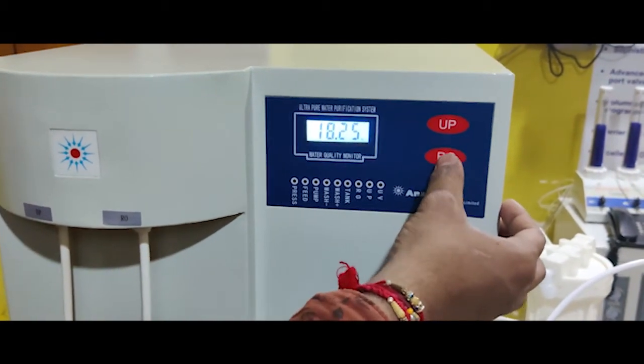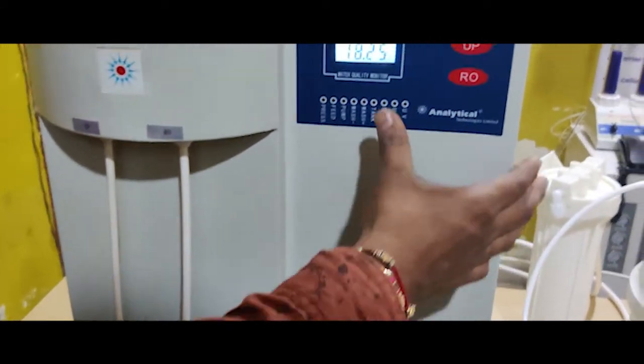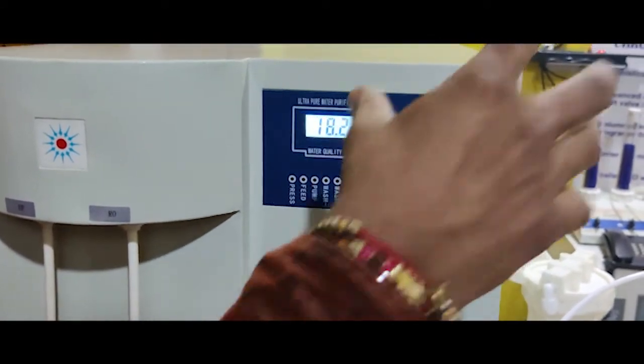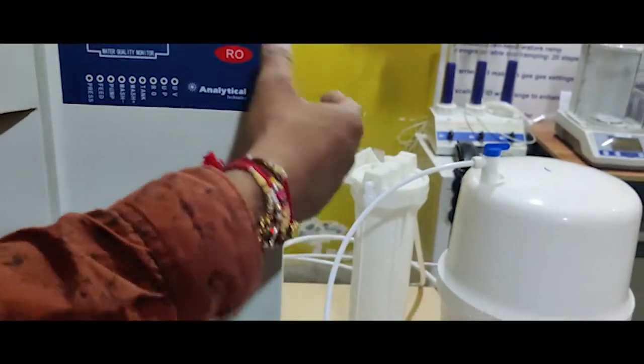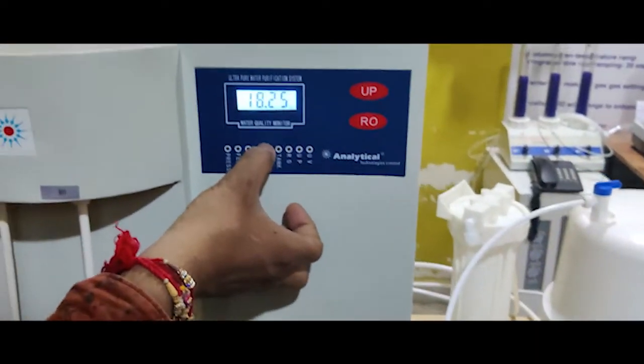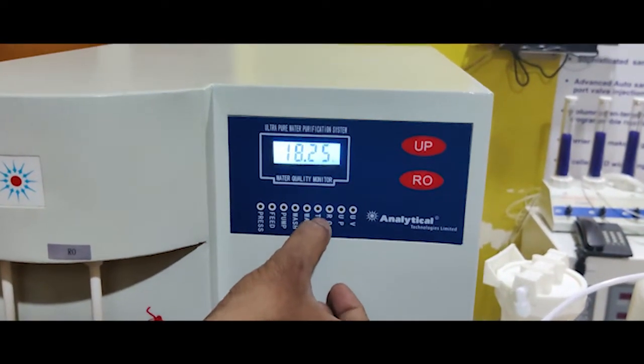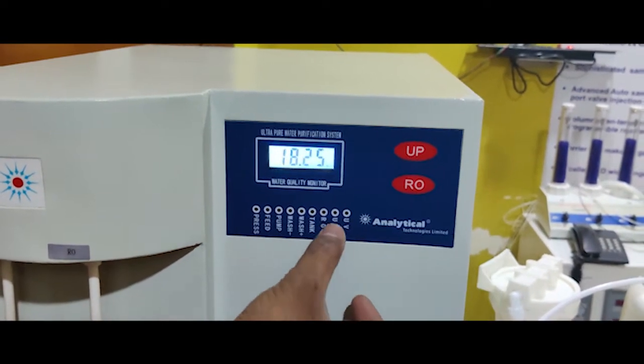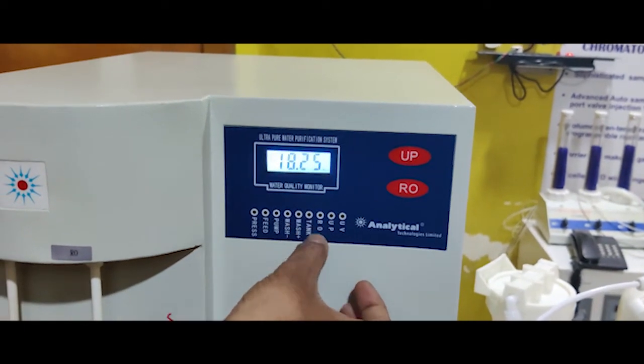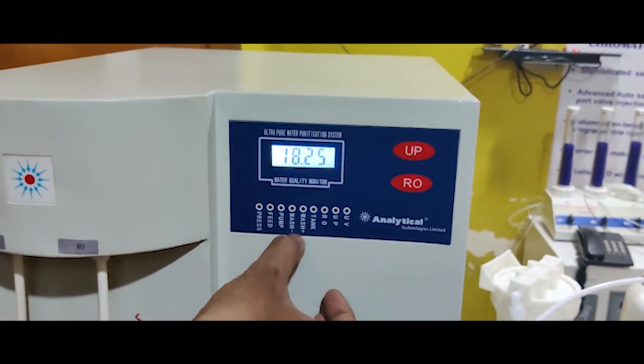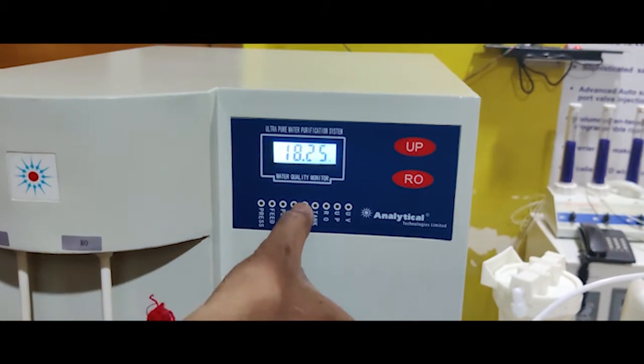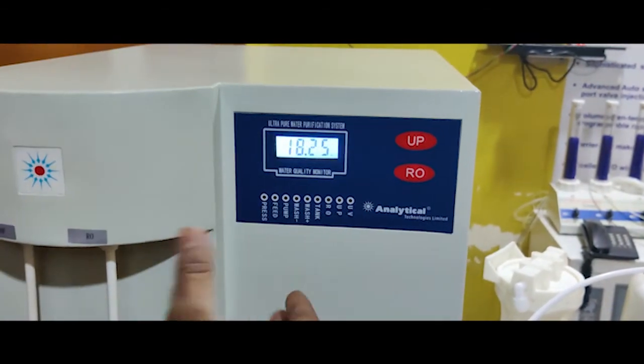We click here and here we take UP water. The tank will be filled. Tank light and UP water can be used here, and washing can be used here automatically.